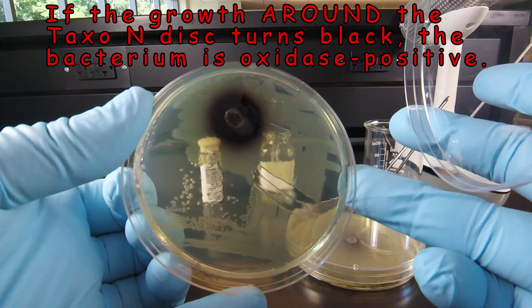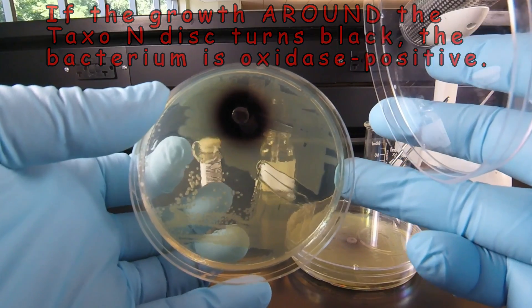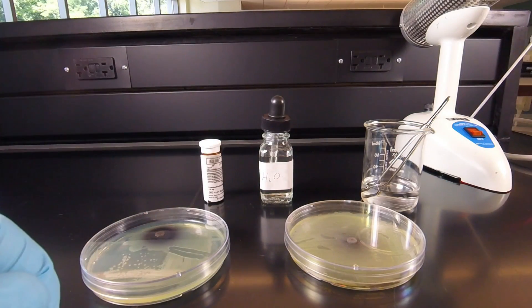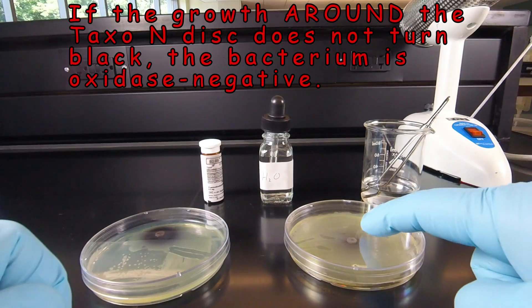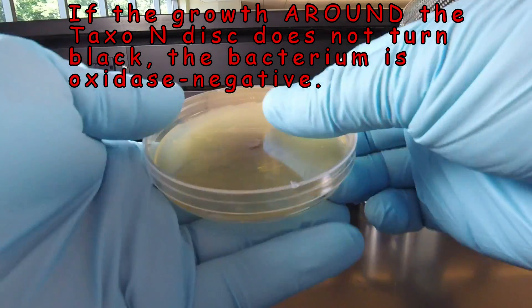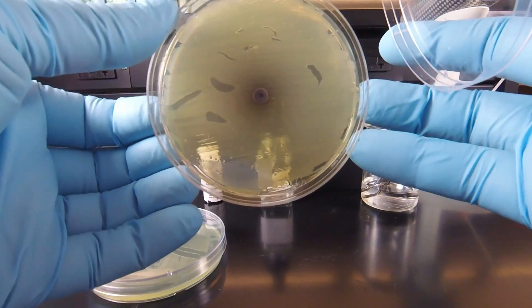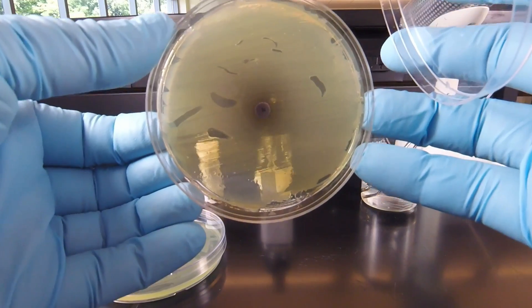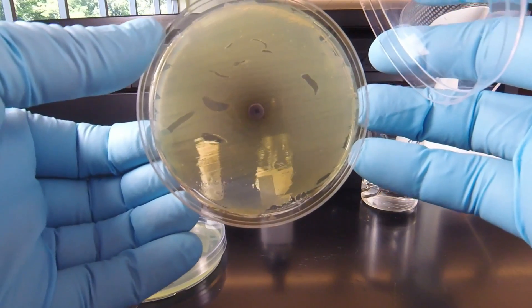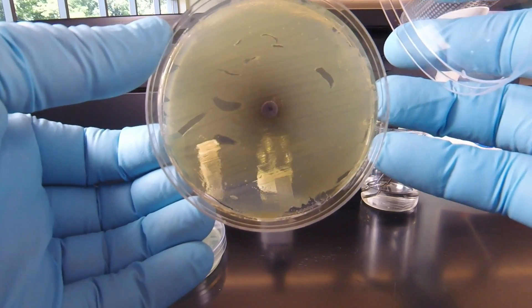If we remove the lid, you can see that black growth around the disc fairly clearly — that would be a positive oxidase test. If the bacterium is oxidase negative, like this Enterobacter aerogenes, there is no black zone around the Taxo N disc. Taking a closer look, there's no thick, heavy black growth around the zone. You might see a slight black colorization from water leaching out of the disc, but not the obvious black you see in an oxidase positive. This would be an oxidase negative reaction.